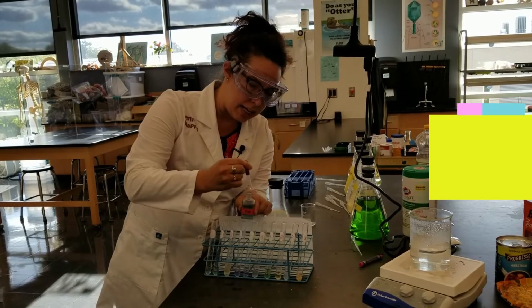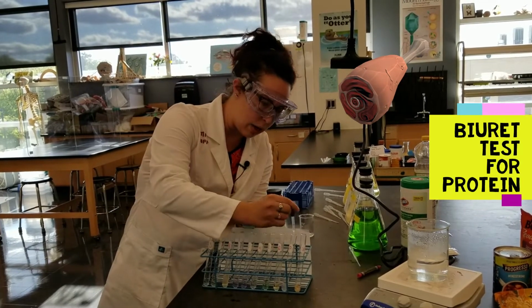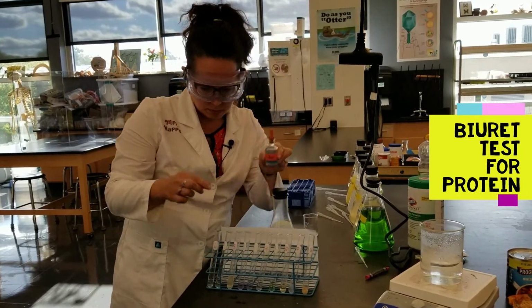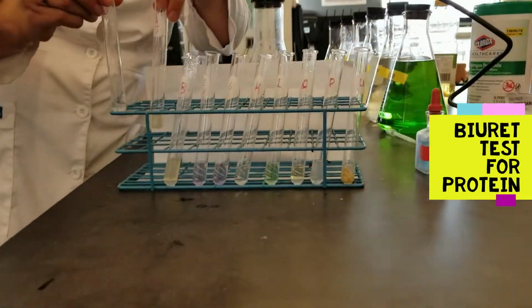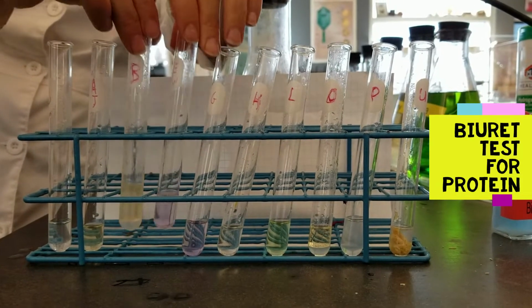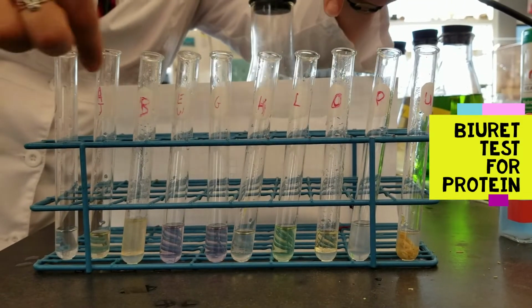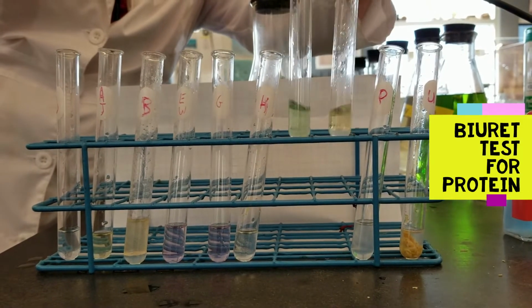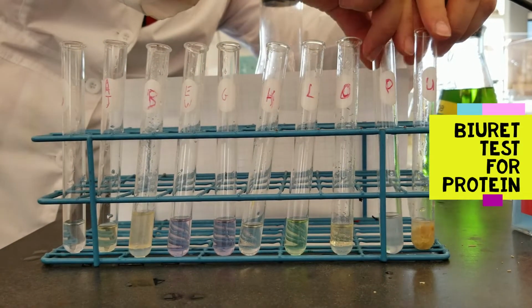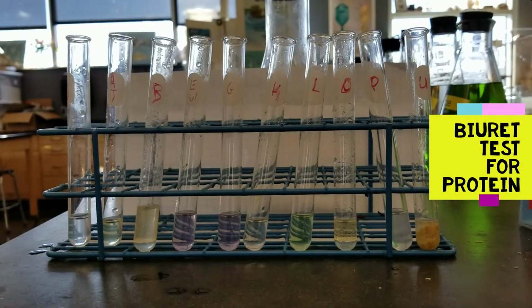Our last test is for proteins, like you would find in meat and cheese and beans. I'm using another blue indicator that's called Biuret solution. We obviously have to be very careful to make sure that we don't mix up Benedict solution and Biuret solution, which both begin with a B and both are blue. This solution does not require heat in order to react. We're looking for a lavender color. Lavender would indicate the presence of proteins.